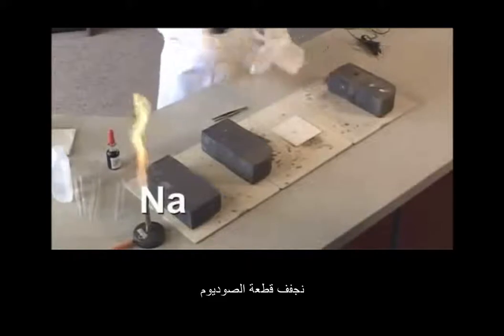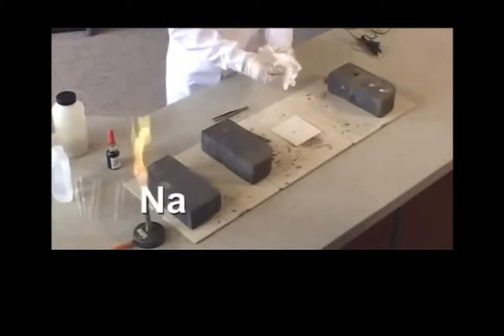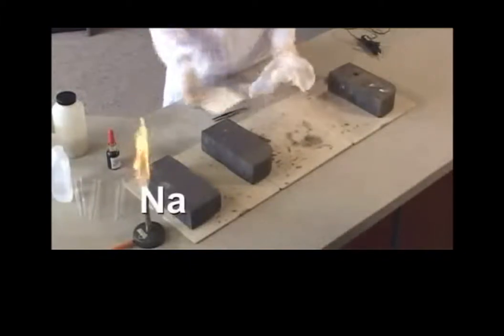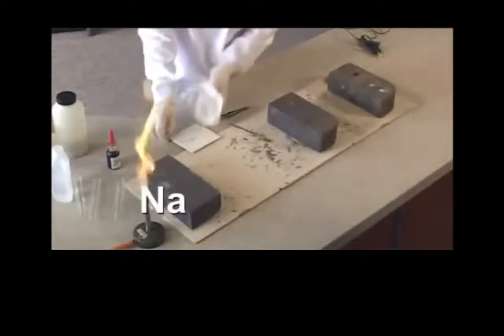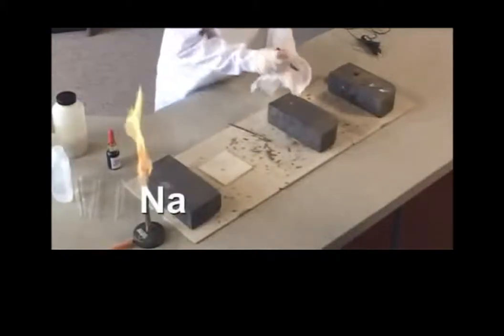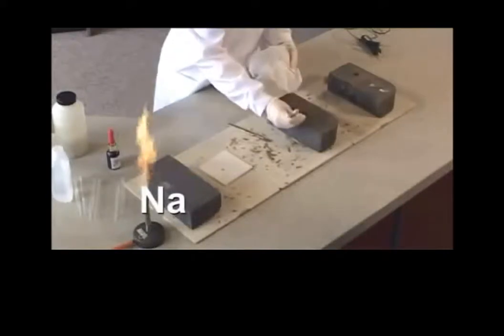Dry off a piece of the sodium and place it on a brick ready to heat.